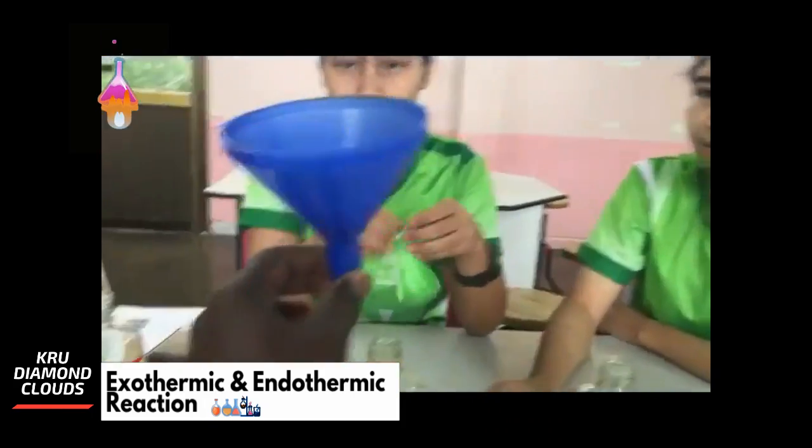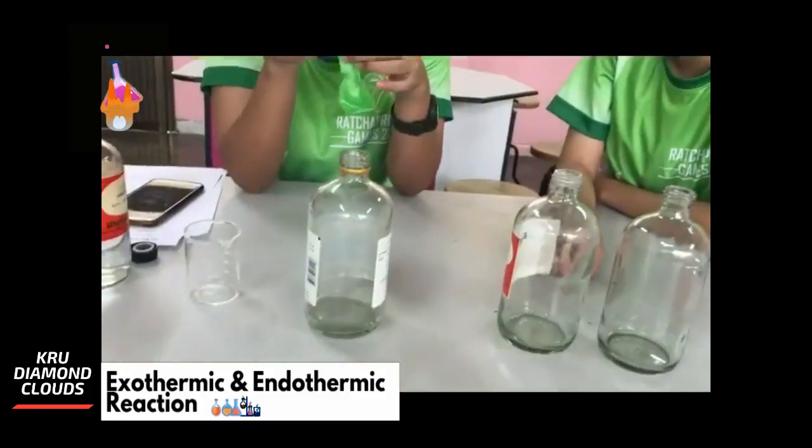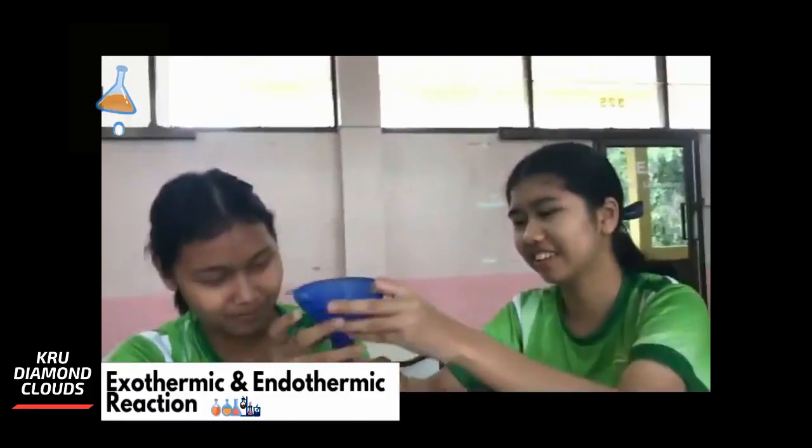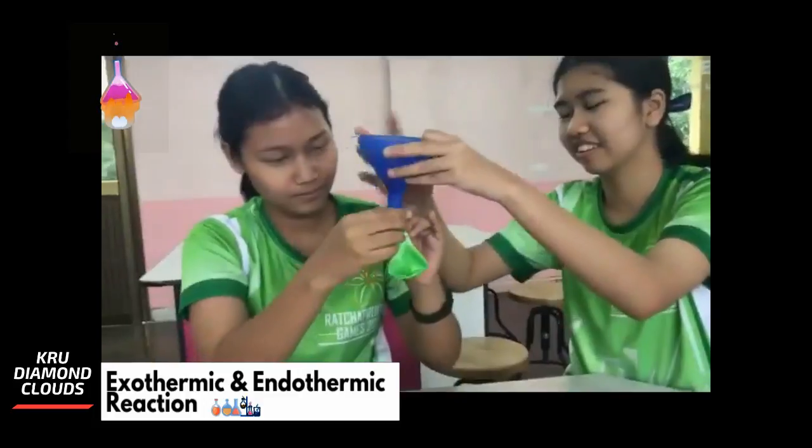Now, because we need the gas to be in a balloon, you take this balloon and attach it to — what is this called? A funnel. So you connect it to the funnel. Let your friend help you.